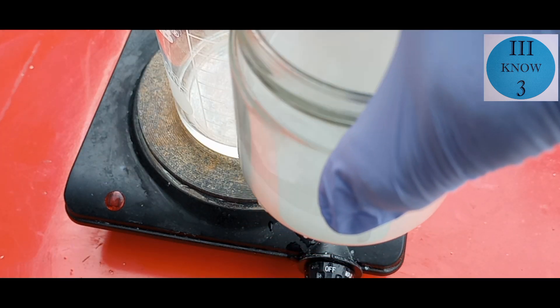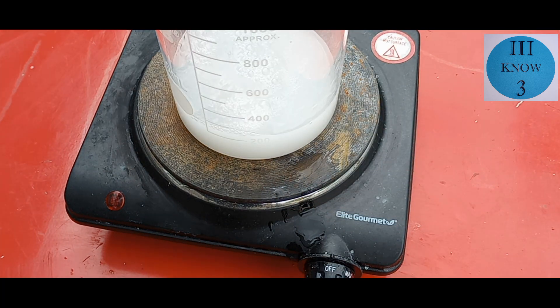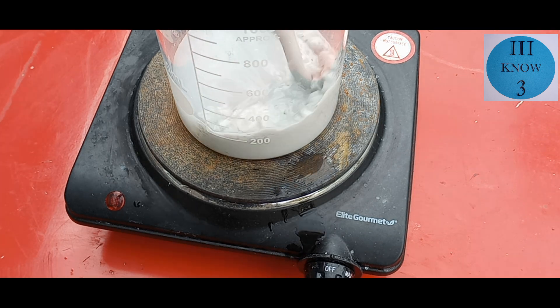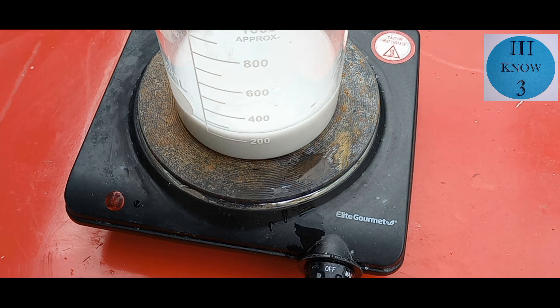Lead metal is commonly found in sources of tin. Lead metal dissolves very poorly in hydrochloric acid, but when you add an oxidizer like I did with the hydrogen peroxide, it dissolves very briefly and then precipitates back out as lead chloride.